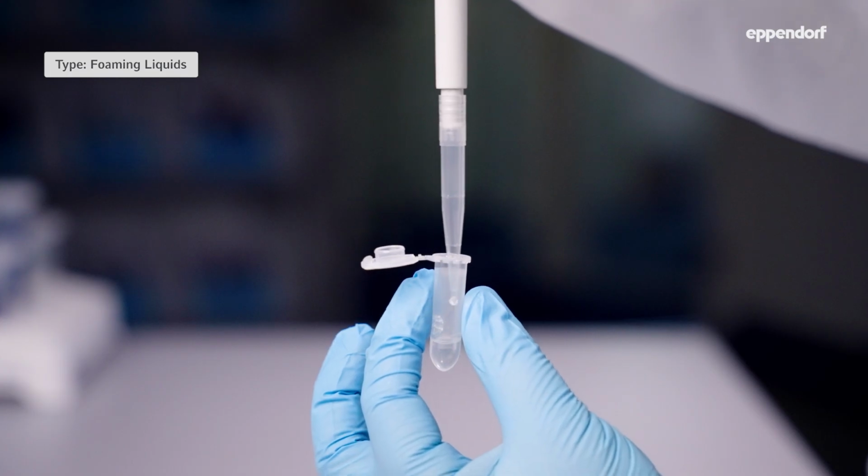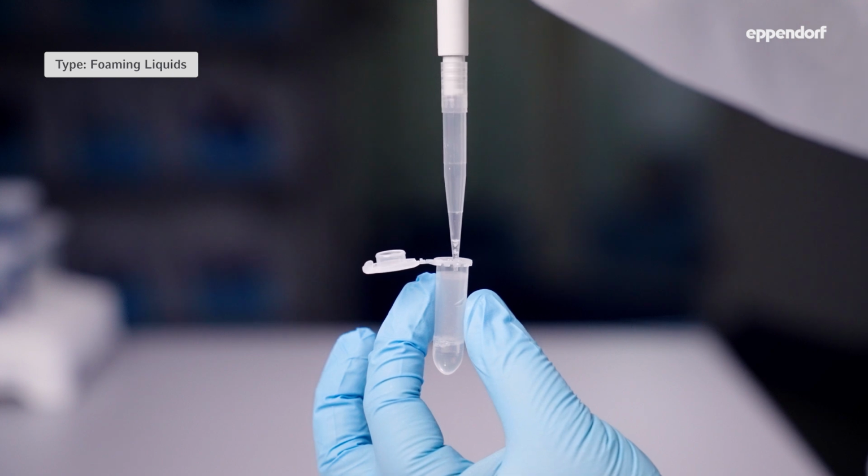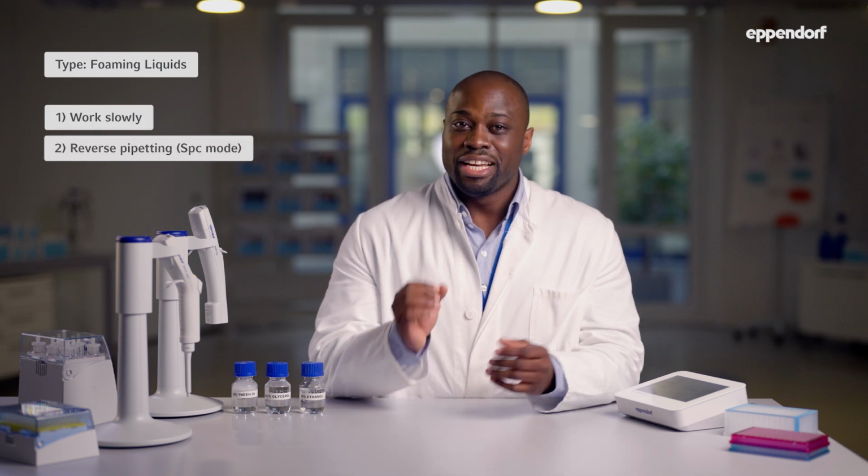What about foaming liquids? Examples of common liquids that foam easily are master mix, liquids that contain detergents like Tween 20, and liquids that contain proteins. Because foam builds up, these liquids often stick to the inner wall of the tip or create splashes when they are dispensed. With an air cushion pipette, foaming liquids are best pipetted by working very slowly using the reverse pipetting technique. If your sample contains a detergent, we also recommend that you use low retention tips. Naturally, the best choice for foaming liquids is again the positive displacement tool.